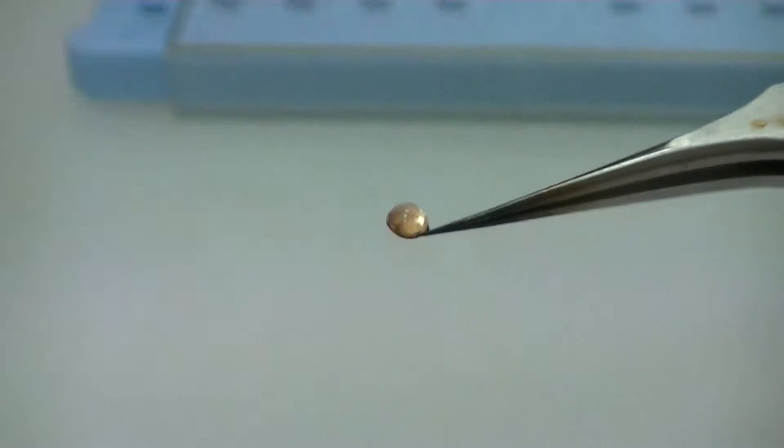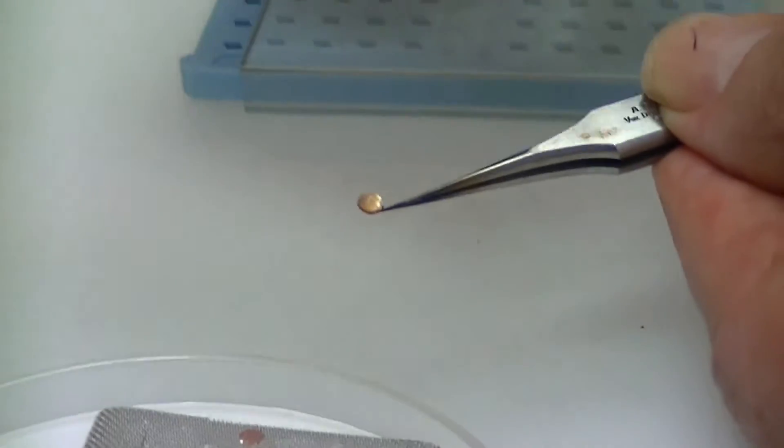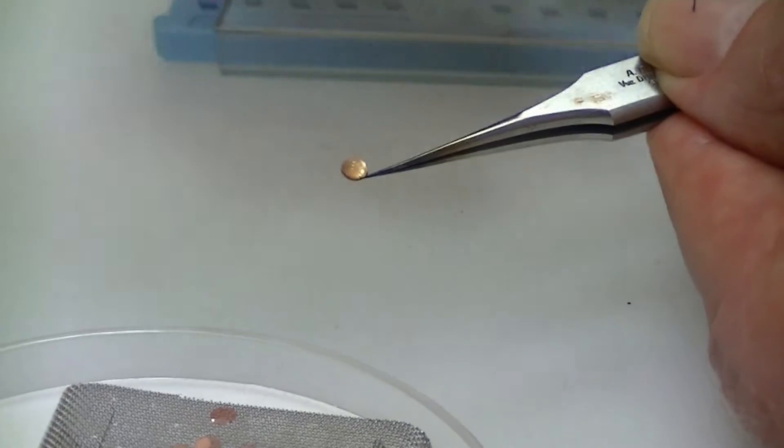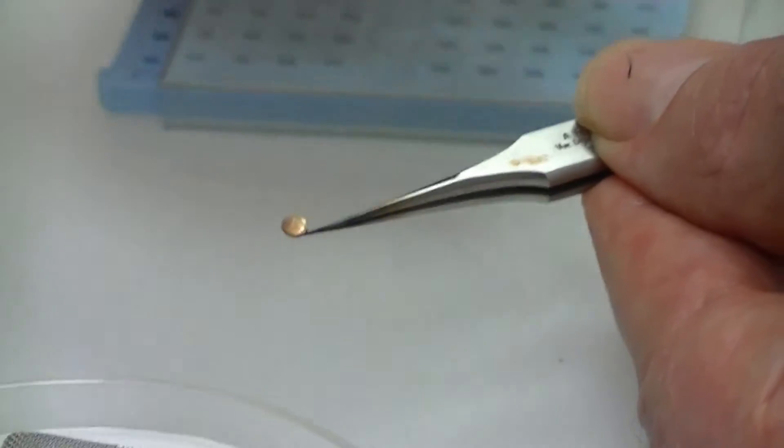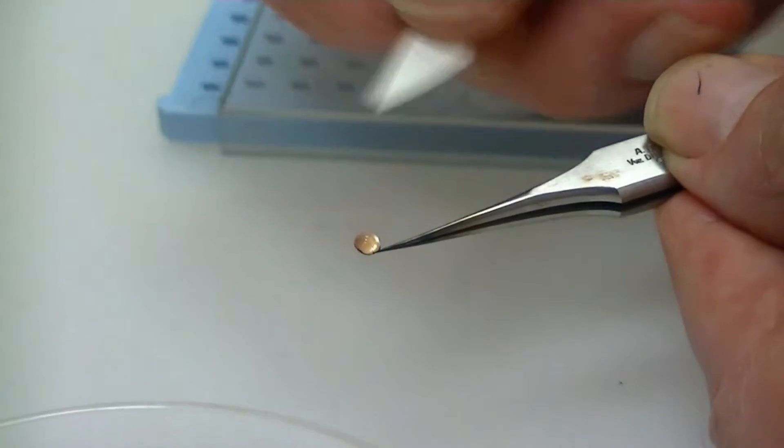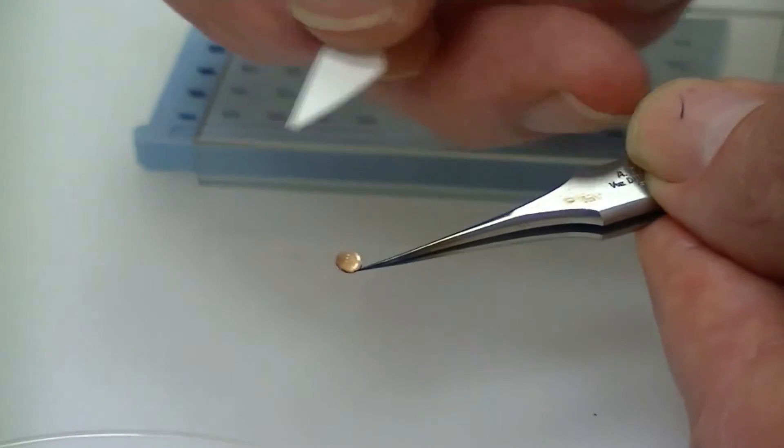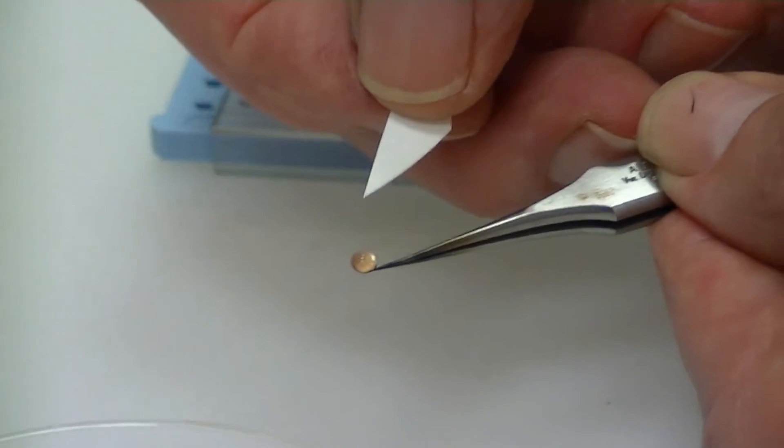And then we leave it there for up to a minute or even longer to allow virus particles in that specimen - it could be sap or it could be purified virus preparation. We allow this drop to stay on the membrane for a sufficient time for a few particles to attach themselves to the membrane.